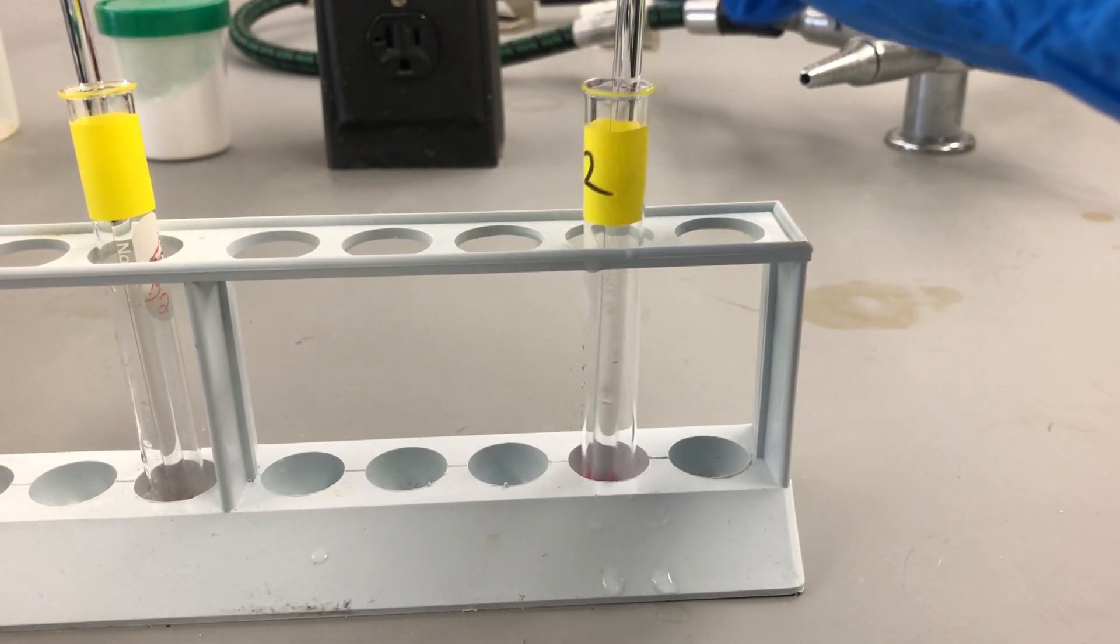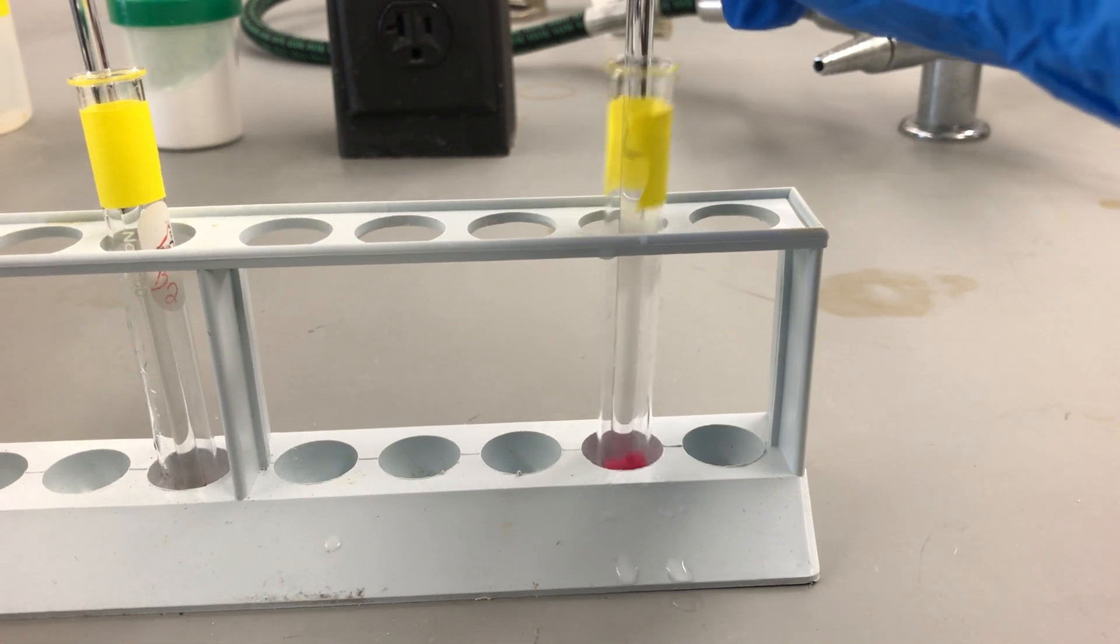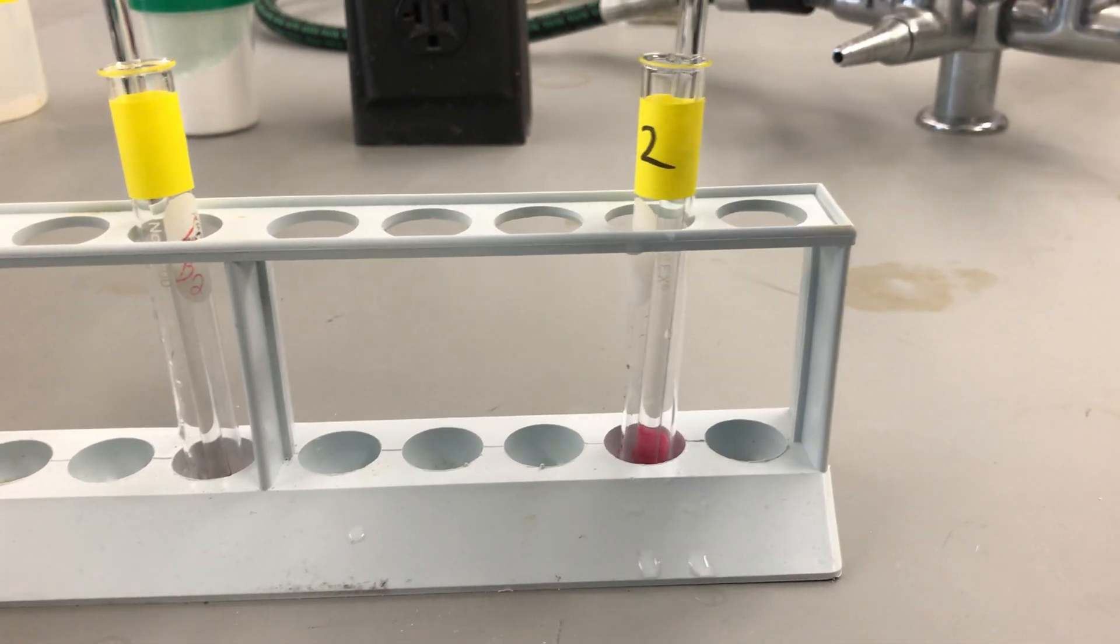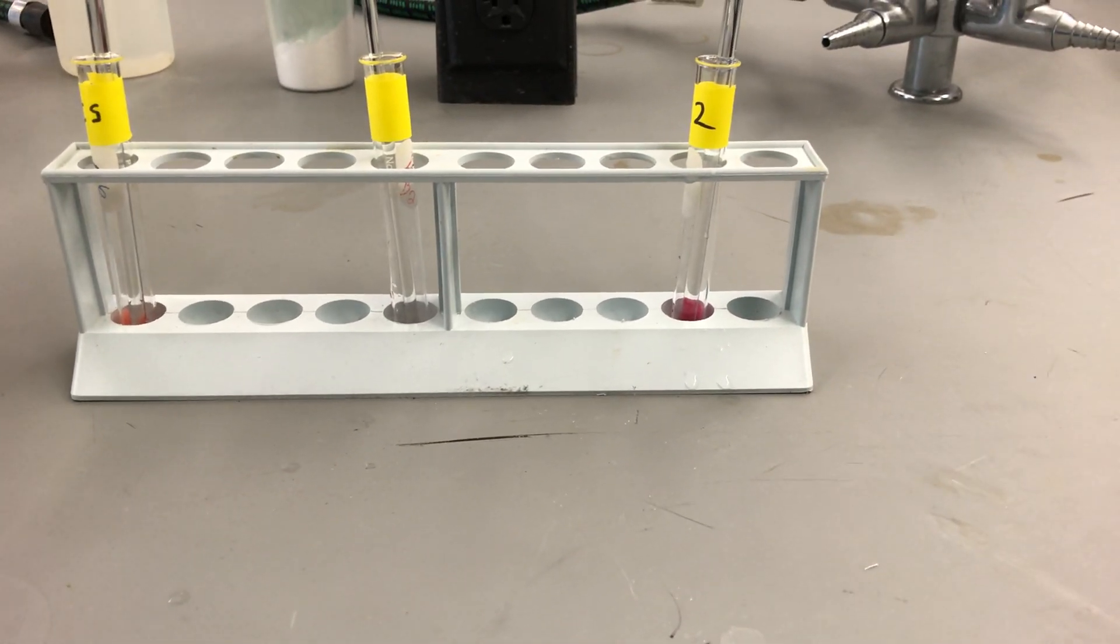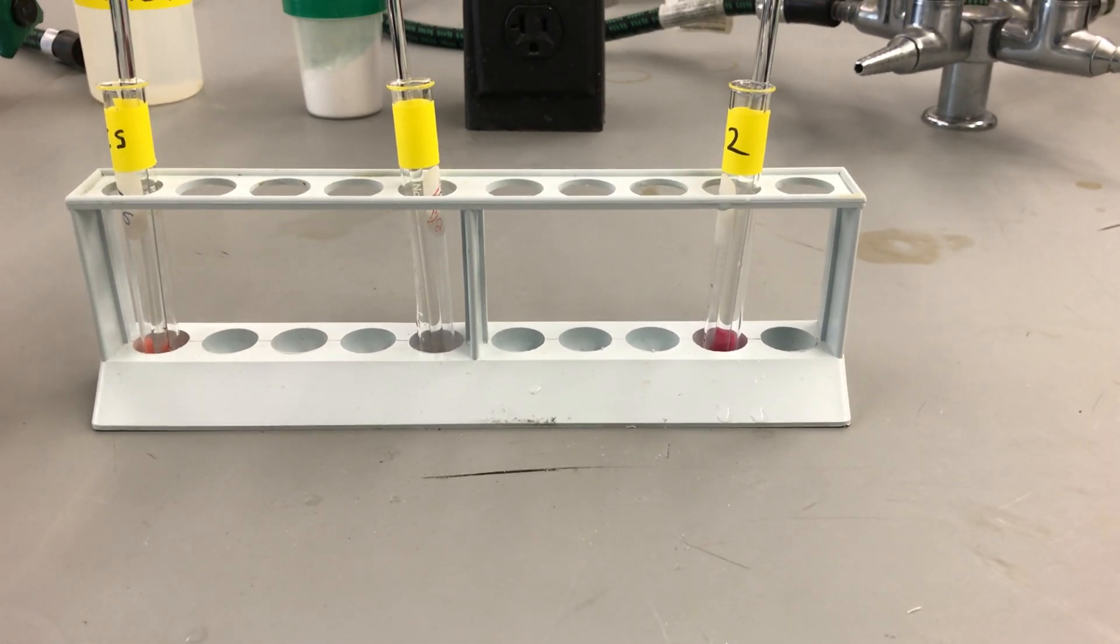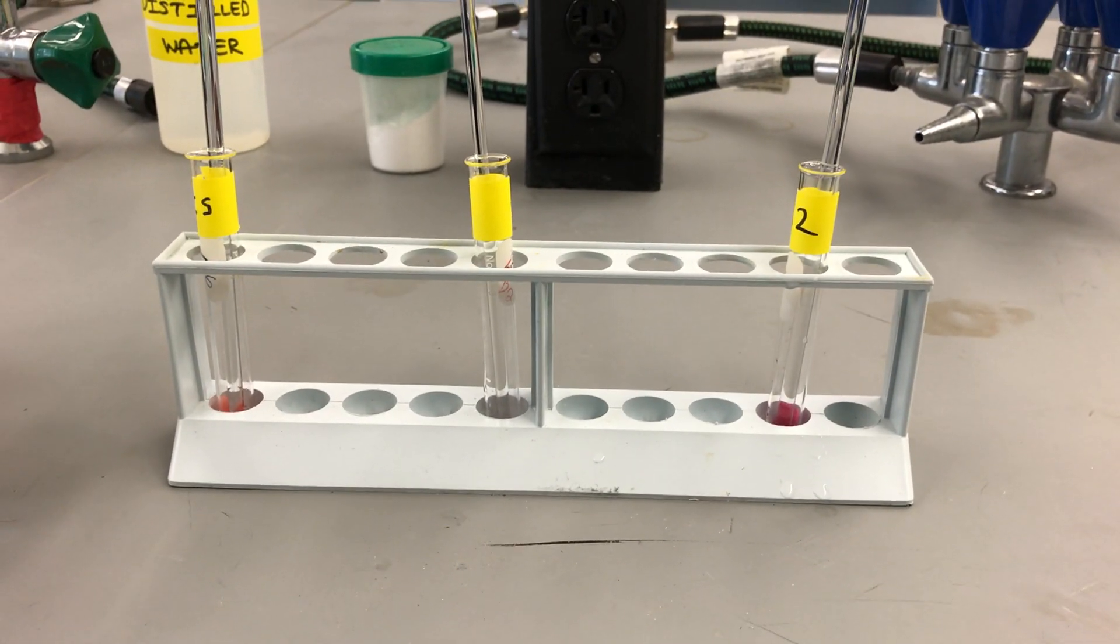And while we wait for that stuff to process, we're going to clean up the extra drips and we are going to work on getting our chromatography plate ready. So, stay tuned.